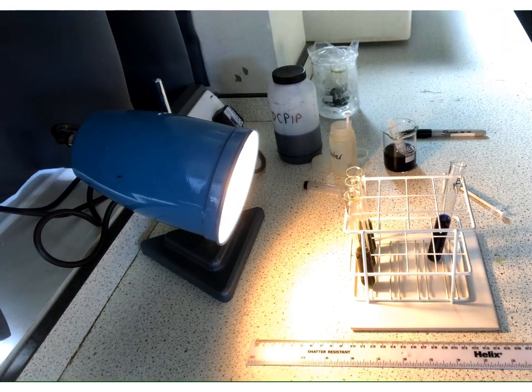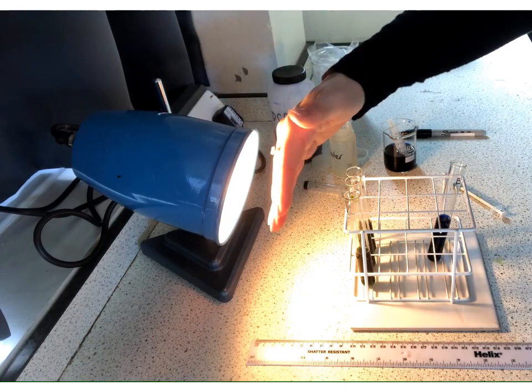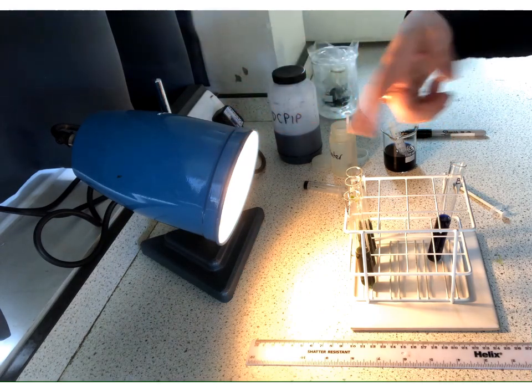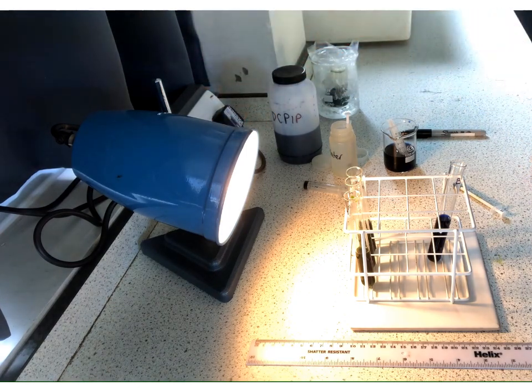Now, an interesting side point to all of this. This is not an energy efficient bulb. In fact, I'm not even sure if I can touch this. This lamp is generating an awful lot of heat. So do consider how this may be affecting the reaction as well. Ideally, you don't want a light source that is also generating heat, because we know that heat will affect the rate of reaction as well. So these are all things that you could list as confounding variables, things that we haven't been able to control adequately. Okay, I think we have reached that point.